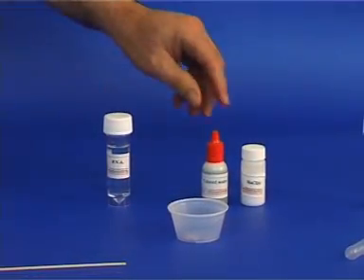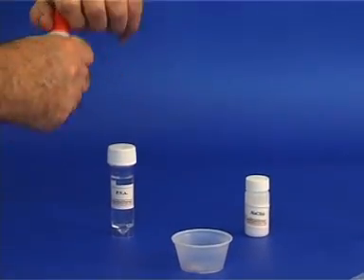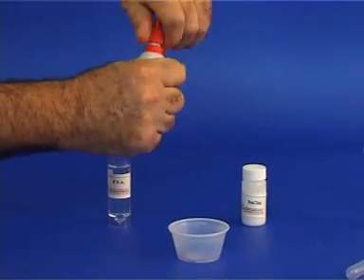Put the borax solution aside. Open the vial with the food coloring and add 3 drops into the reaction vessel.